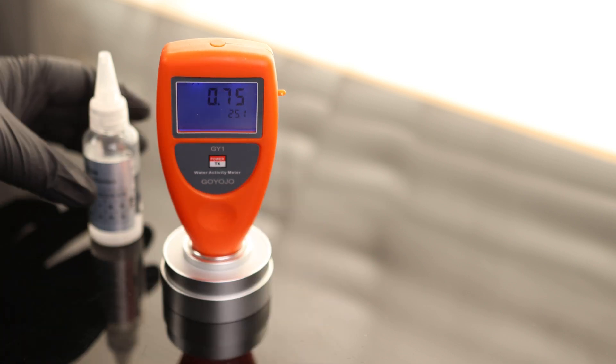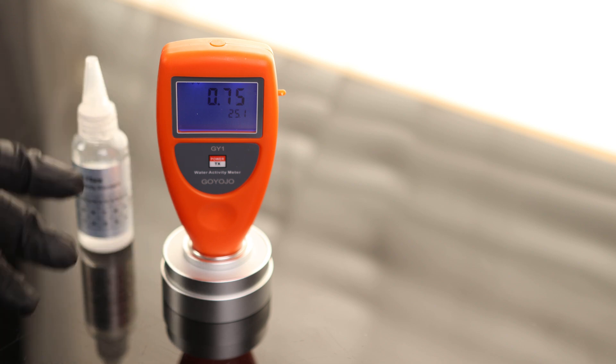Very easy to calibrate. If you don't want to make the solution, just get this pre-made stuff. I just got to clean this guy up and that will be ready to go.